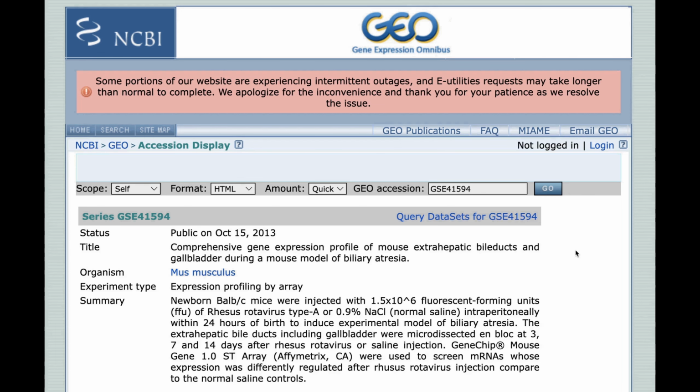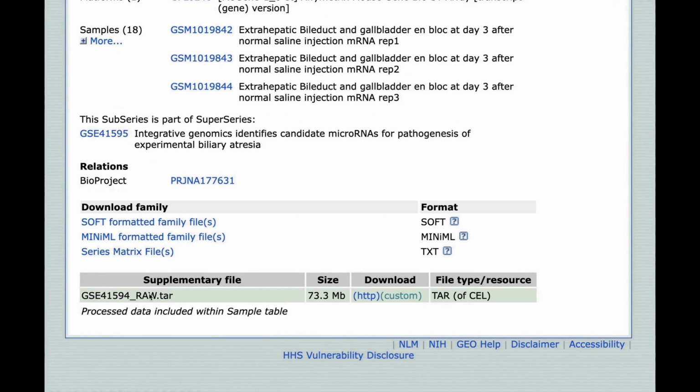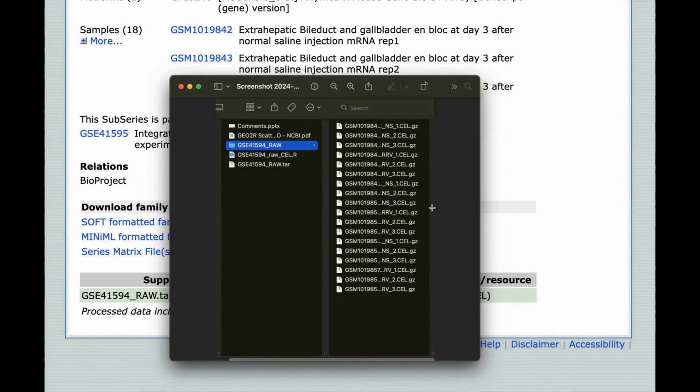Before you open RStudio, you have to do a few things. First, you visit the NCBI GEO, dial this number, then you download this raw tar file. Then you get this raw tar file on your computer, move it to a place you want and untar it, and then you will see a series of CEL files, GZ compressed.